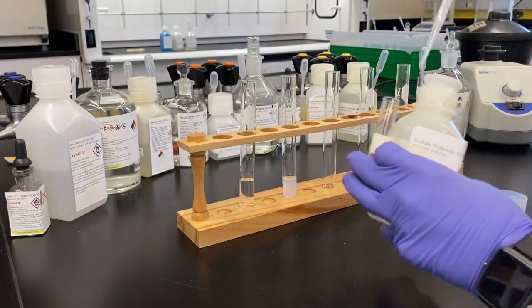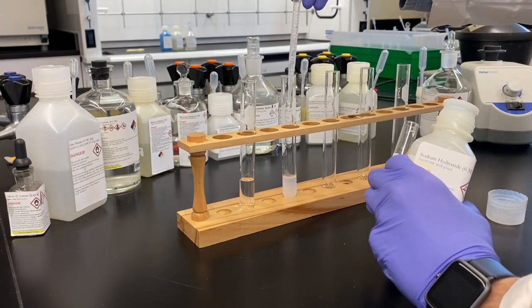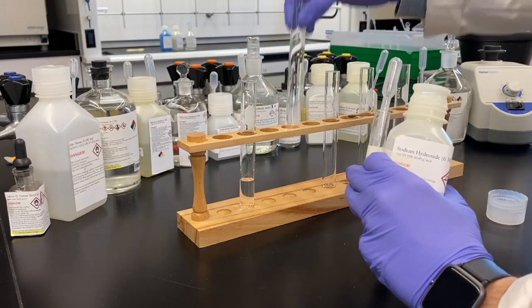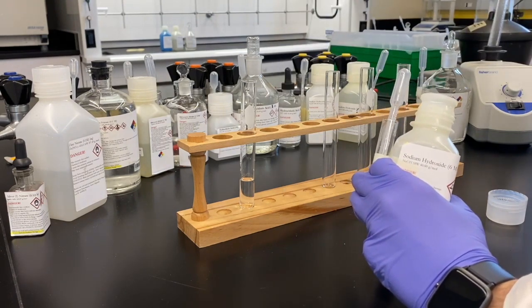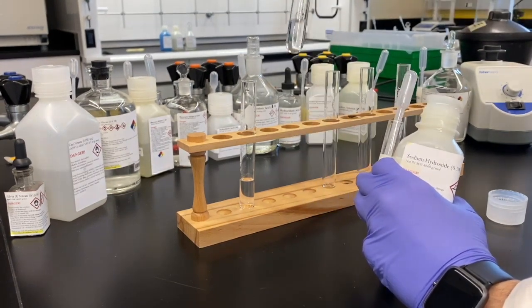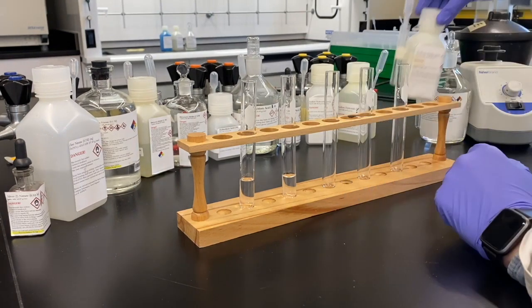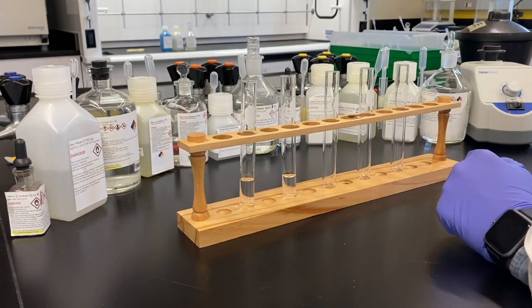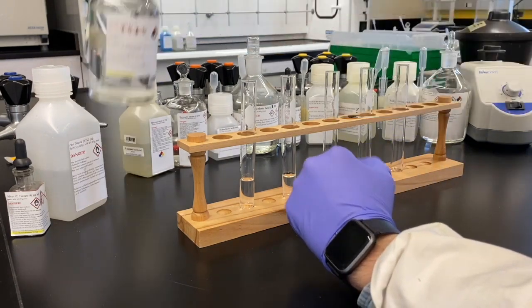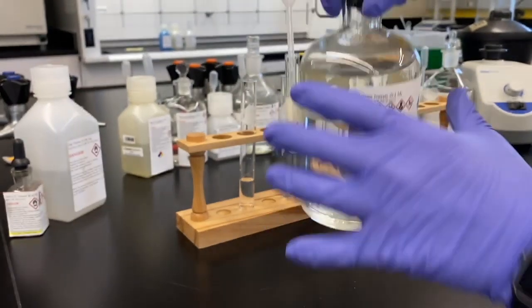We're going to add an even stronger, higher concentration of sodium hydroxide to see if this redissolves. If it dissolves in the presence of additional base, making a higher hydroxide complex, then it will be amphoteric. And we've demonstrated there, as it's redissolved, that this is an amphoteric species. Can you just jog my brain again? What's amphoteric mean? Amphoteric means that this species behaves as both an acid and a base.